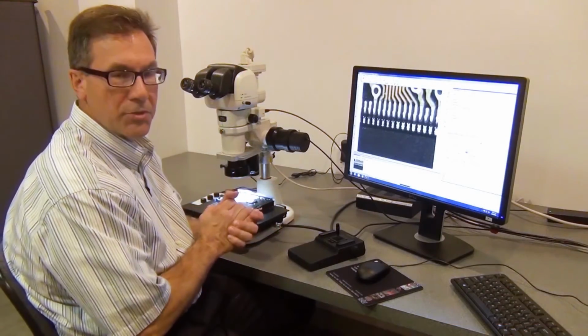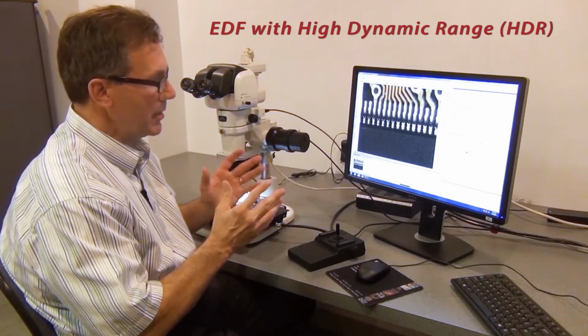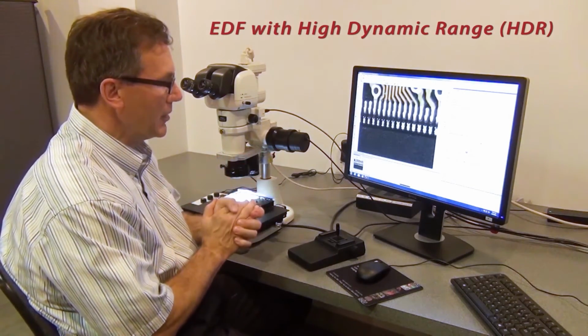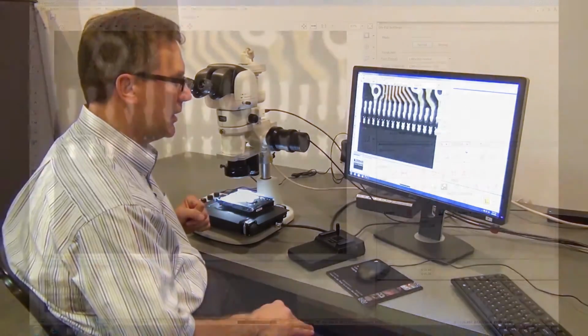So the next technique I'm going to show you is EDF with HDR. So HDR is high dynamic range. The software has the ability to capture images and get rid of the glare that quite often happens when you have shiny parts such as these solder joints in this circuitry of this hard drive I'm looking at.